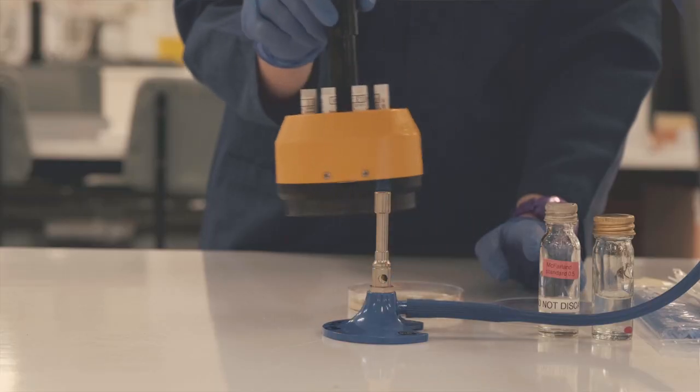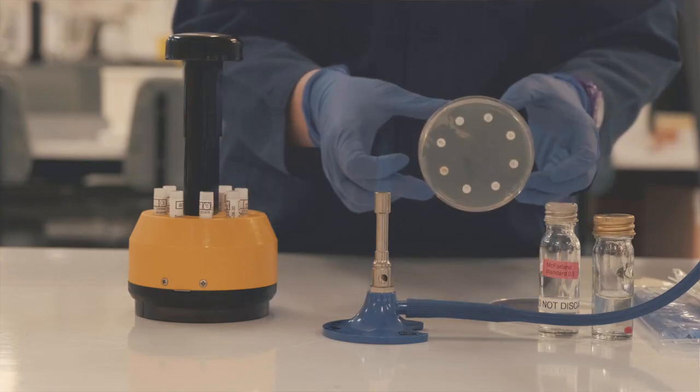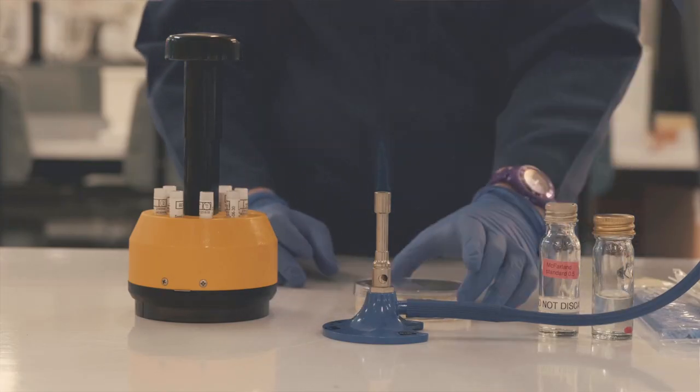Don't press down too hard — we only want the individual disc to touch the plate, not the edge of the dispenser itself. When we're done, you can see the discs neatly pressed onto the plate in a circular configuration. Each disc is a different antibiotic pre-calibrated at the right concentration for resistance testing.